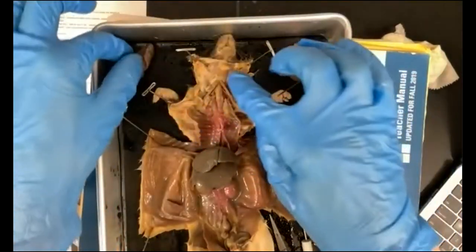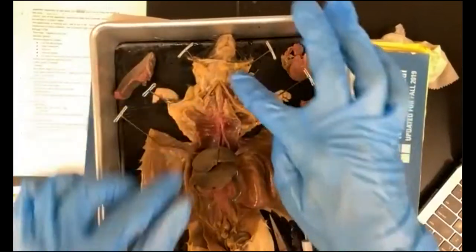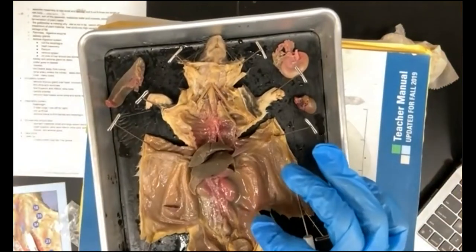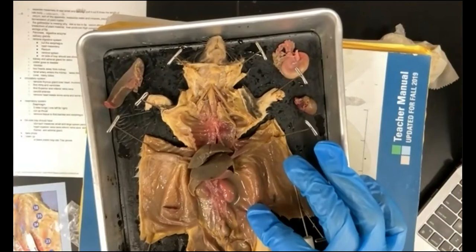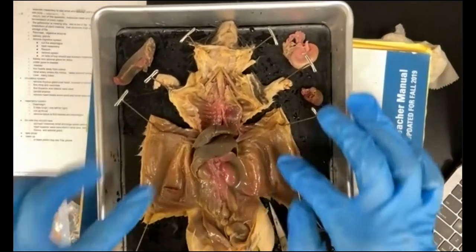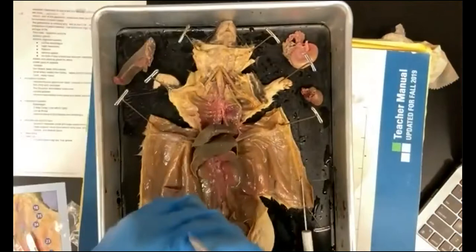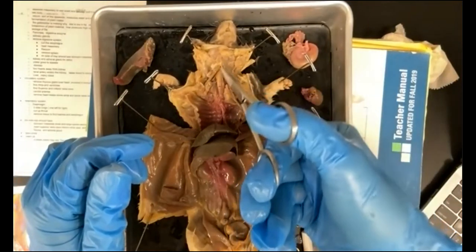Okay, so salivary glands up there. We can leave that there. You can identify that. And the kidneys are here. We have not covered the reproductive system, so we're not going to go into the reproductive system. So that, my friends, and here's more salivary tissue, is as far as we are going to go today.